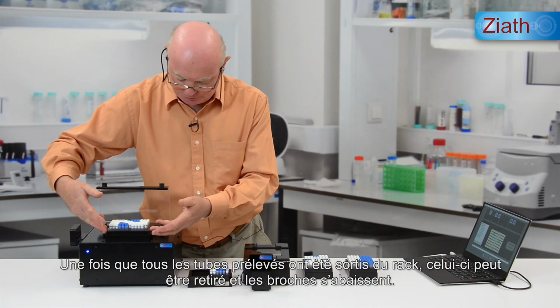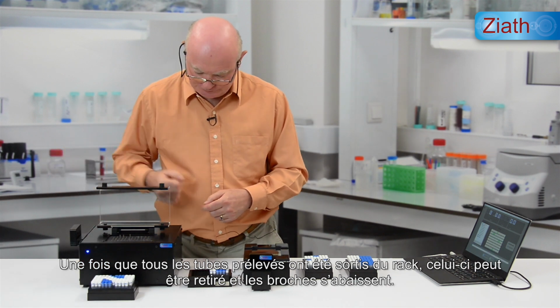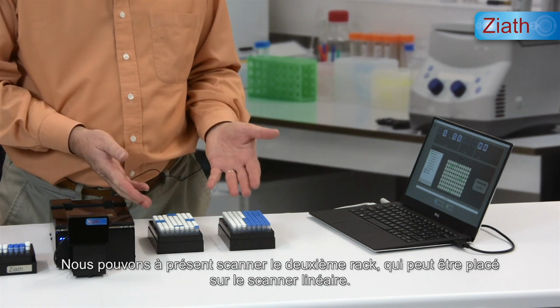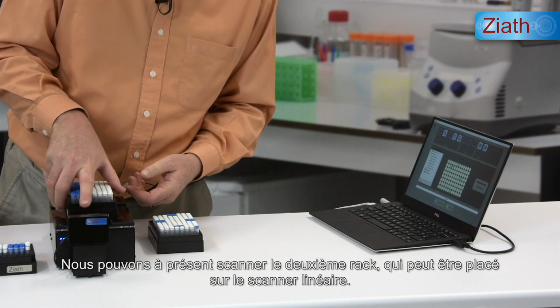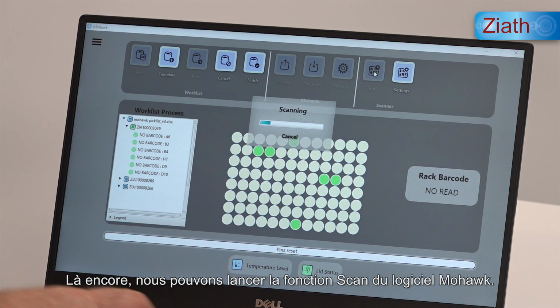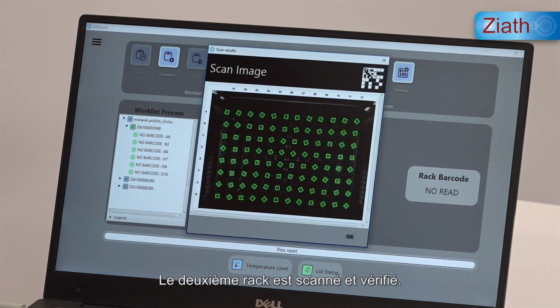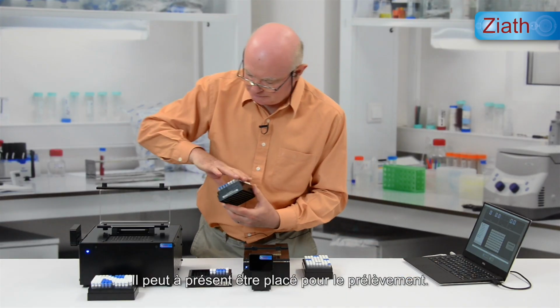Once all of the picked tubes have been taken from the rack, that rack can be removed and the pins will drop. We're now ready to scan the second rack, which can be placed onto the linear scanner. Again, from within the Mohawk software, we can key the scan function. The second rack is scanned and verified, and it can now be placed for picking.